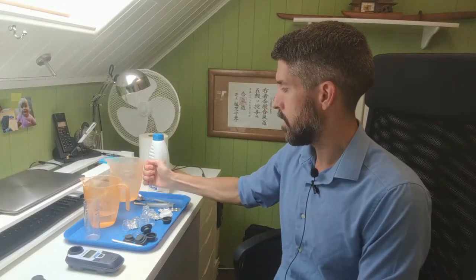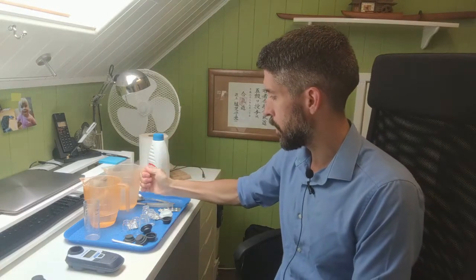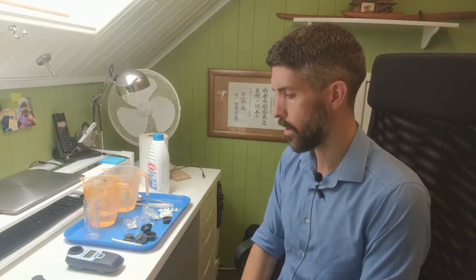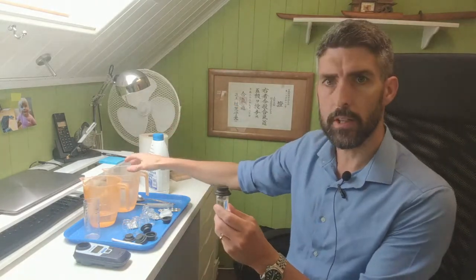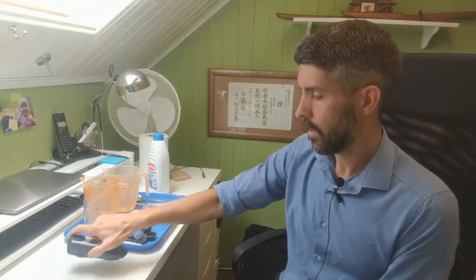I have a sample of chlorinated water here that I'm going to do a DPD1 test on for free chlorine on the photometer. So what I've got here is a blank. This is just a sample of this chlorinated water. I'm not going to add a DPD1 tablet to that. That's just going to go into the photometer when I'm ready to test it, to zero it.